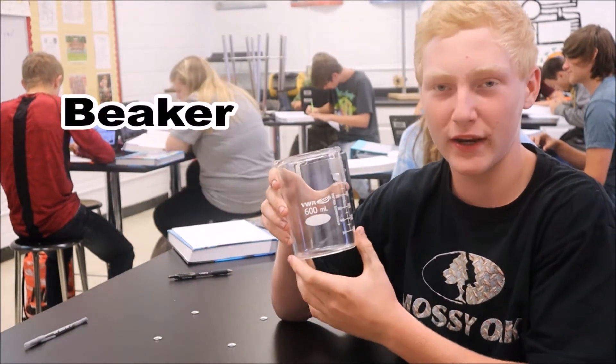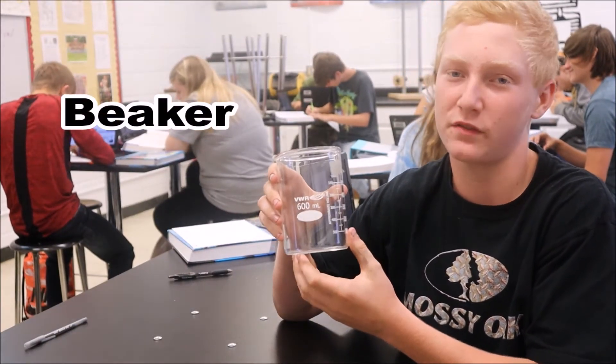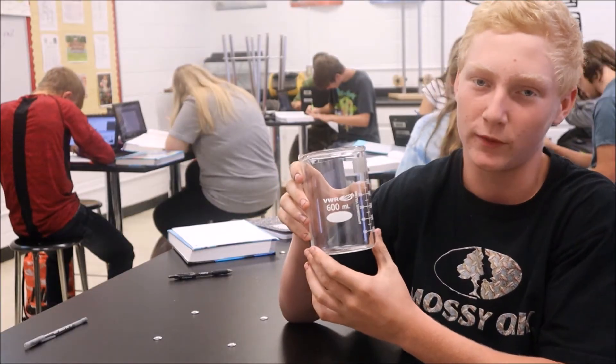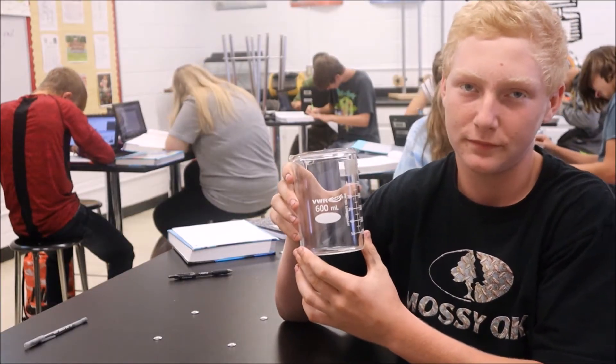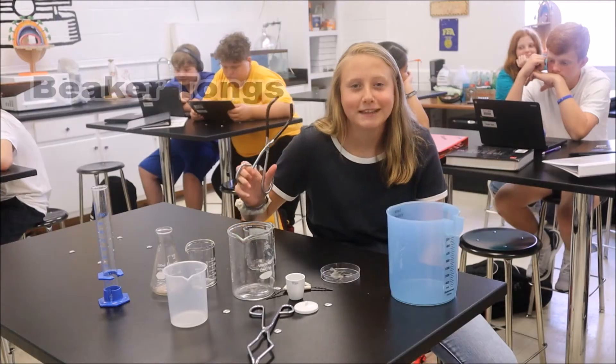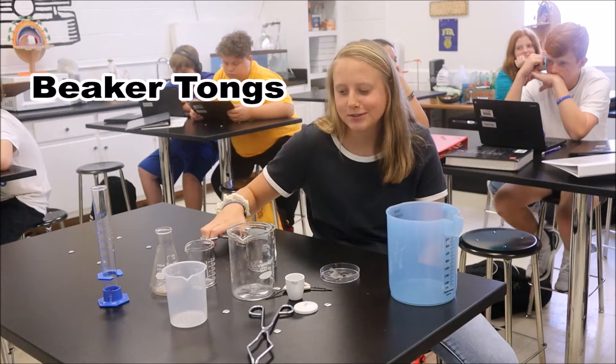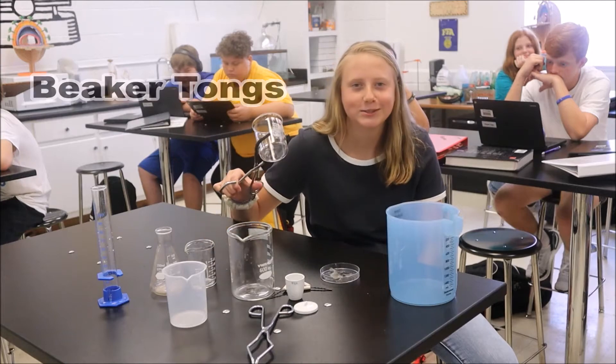This is a beaker. A beaker is a container with a flat bottom that scientists use to hold liquid. These are beaker tongs. They're used to hold beakers.